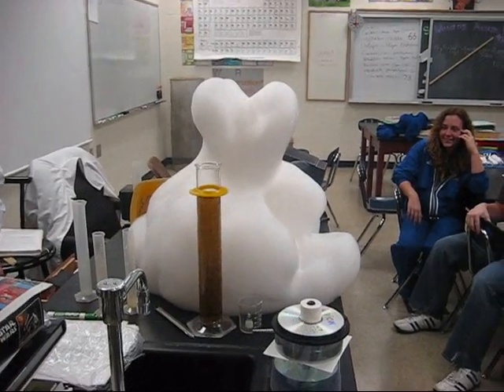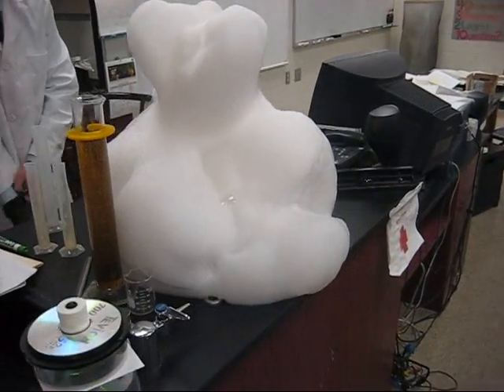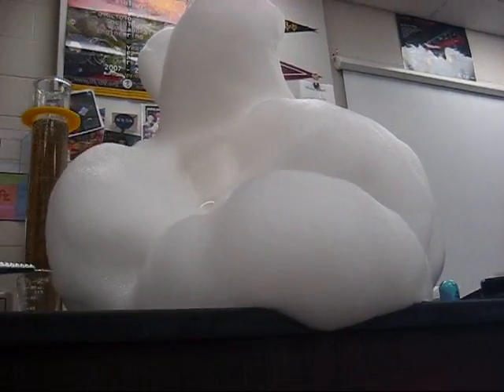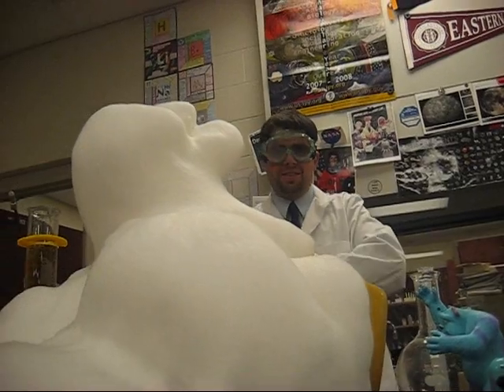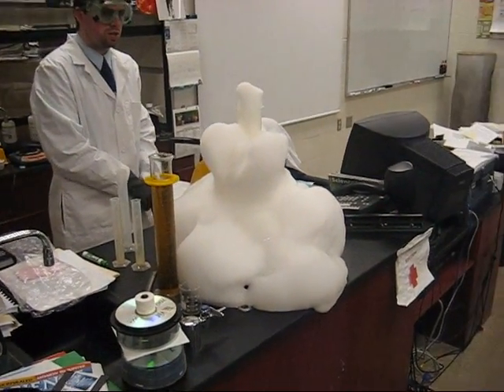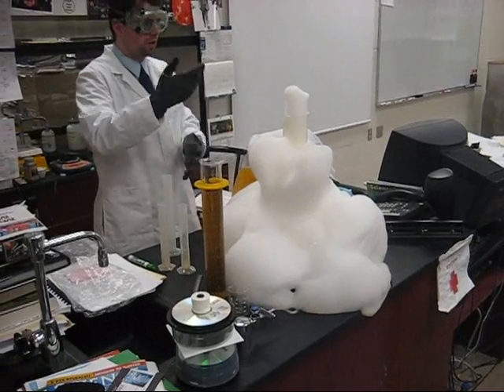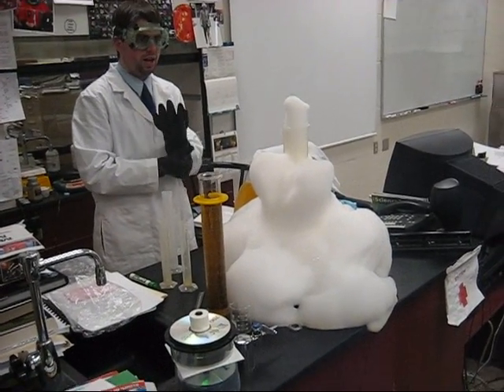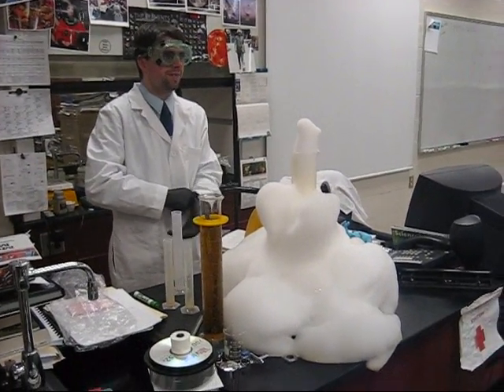It's steaming. Why is it steaming? Steam is coming from the fact that this is an exothermic reaction, which means that it gives off heat. The hydrogen peroxide — all I did was force it to decompose. You may recall earlier we did a reaction where I used manganese dioxide to decompose the hydrogen peroxide. That's the one I did up here that took off when we did the decomposition reaction. Here, I have simply decomposed hydrogen peroxide with a different chemical, and the soap is what makes this, of course, foamy. This demonstration is frequently called Old Foamy.